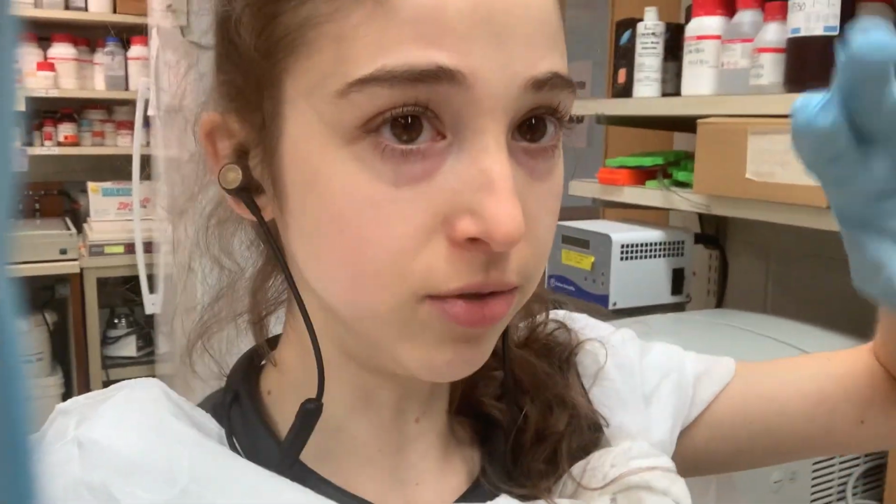And you want to make sure that you add the two reagents, the APS and the TEMED, quickly after one another, but after a little shaking, so you don't get pockets that are polymerized and others that aren't. So you want to make sure it's mixed, but you don't want to introduce bubbles while mixing. Just inverting up and down a few times typically does the trick.